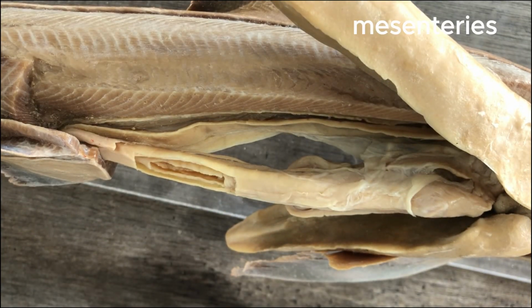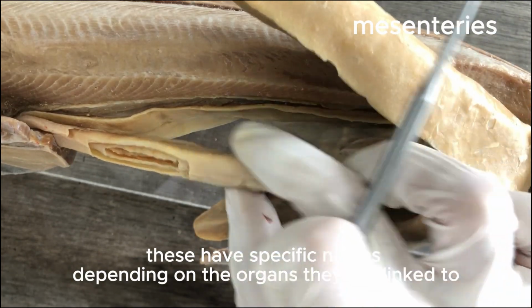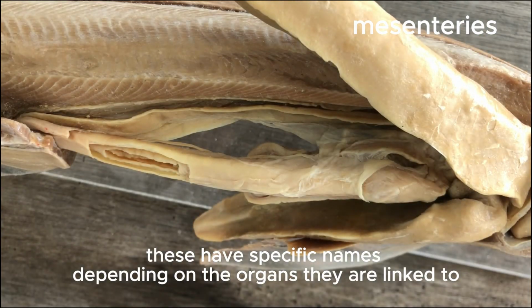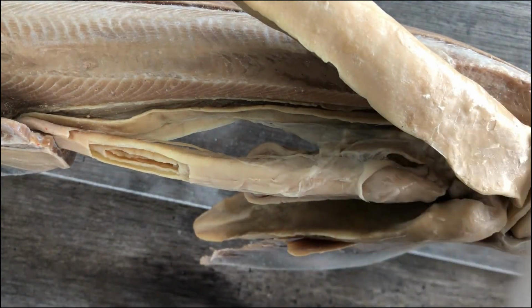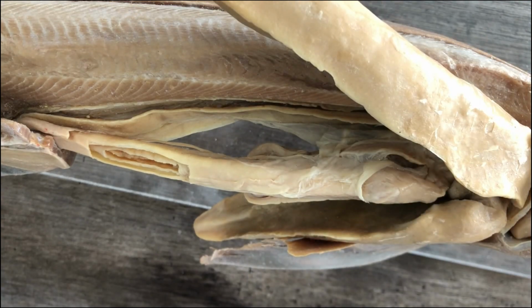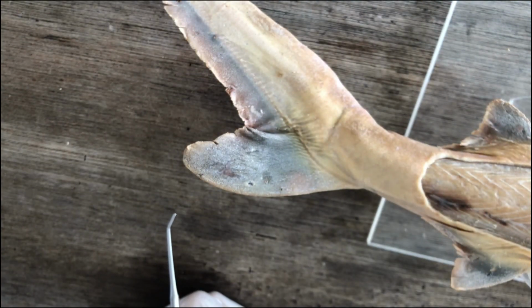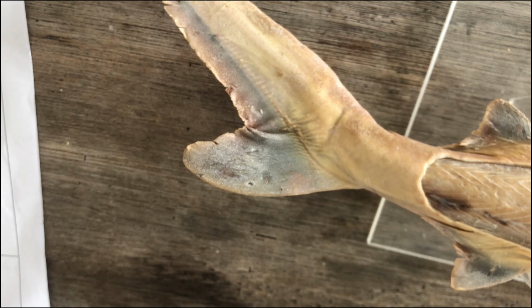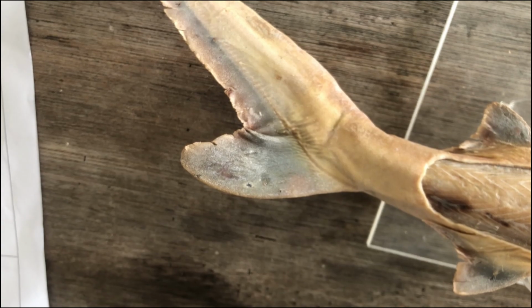There are also mesenteries, right? Those are the connective tissues that suspend the visceral organs inside their cavities so that they won't just be shaking and being disarranged inside the cavity. So they have a fixed position and they are held by mesenteries, but we won't identify them in our wet specimens or our plastinated specimens. You just have to know that there are mesenteries. There are dorsal and ventral mesenteries, depending on their position. So study them. But that's it. Oops, I forgot to tell you something.